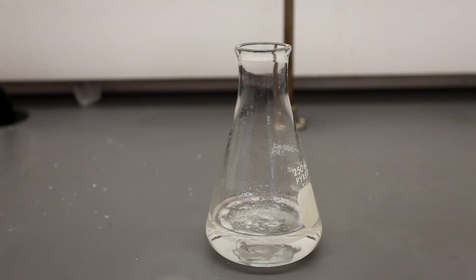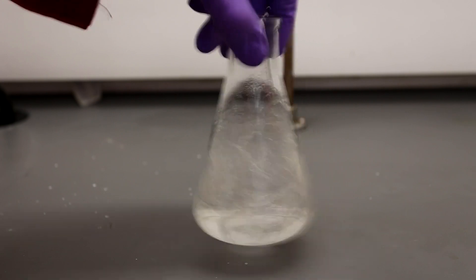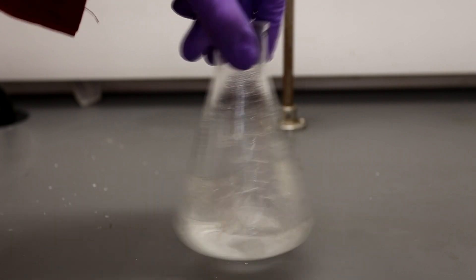In the end, the solution should be completely transparent with a small ether layer on top and a larger aqueous layer on the bottom.